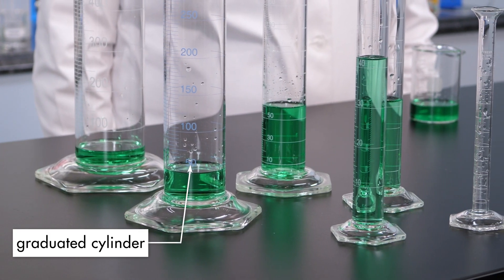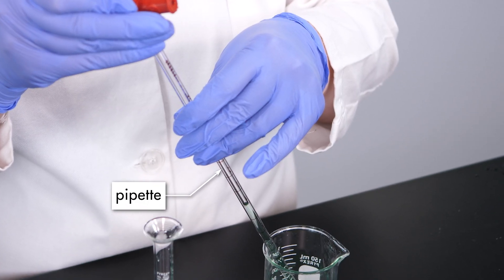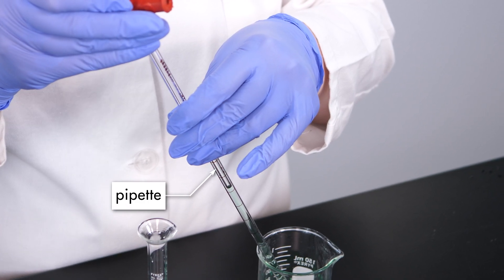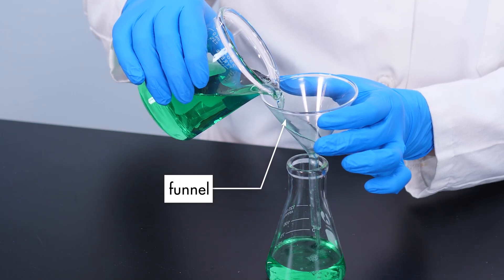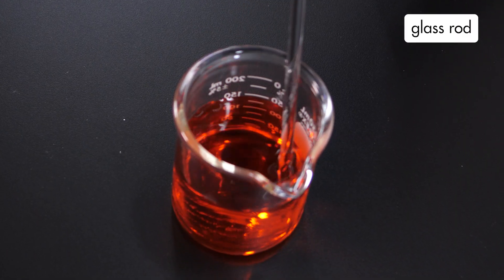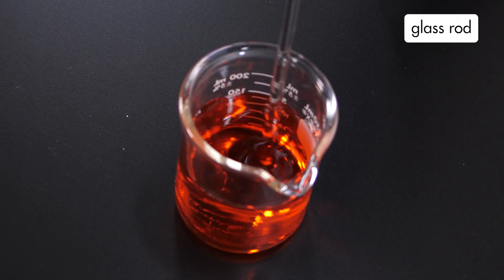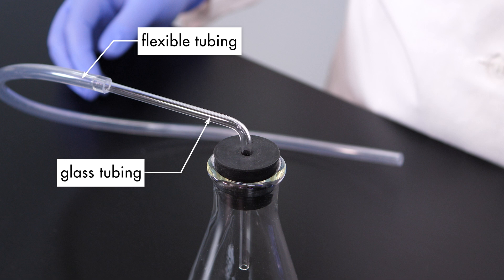Graduated cylinders and pipettes are used to measure liquids. Funnels are used to help when pouring liquids. Glass rods are used for stirring, and tubing is used for transferring liquids or gases from one container to another. All other equipment used in the lab is called hardware.